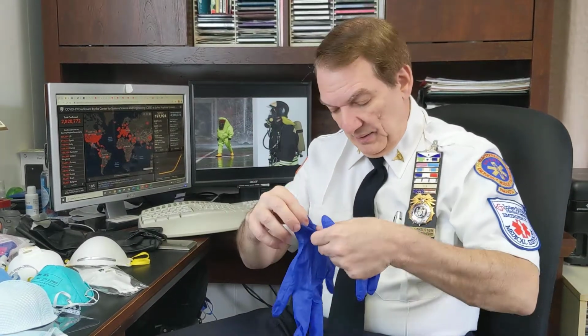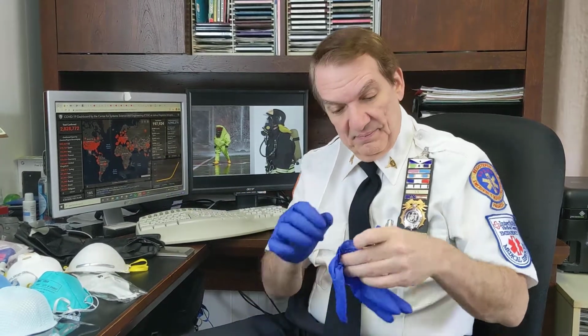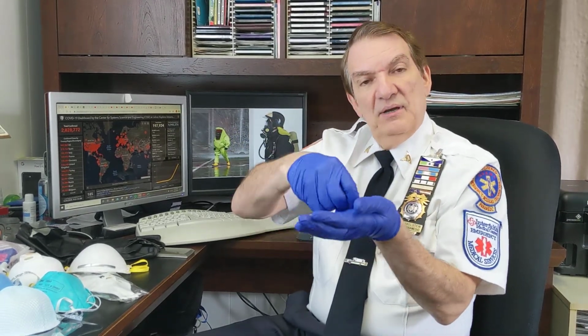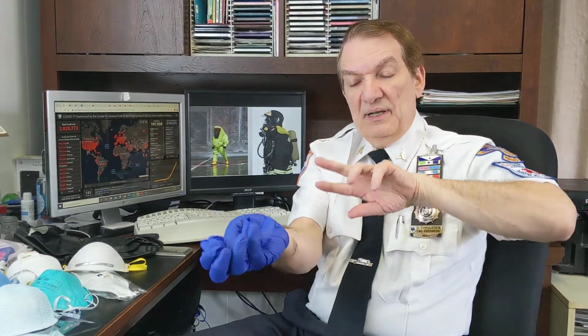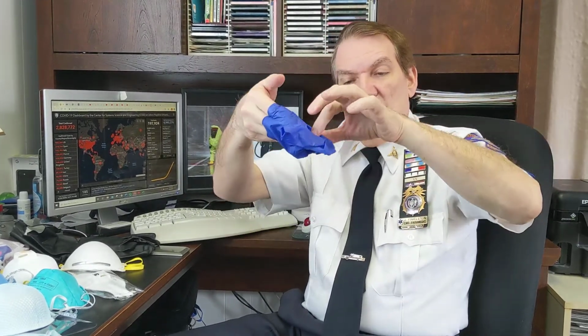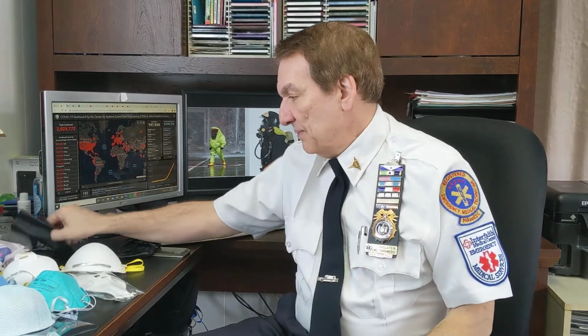So there's a proper way to remove the nitrile gloves, or any gloves actually. I want to be sure that everybody's familiar with this. Once you're finished with using the gloves, you pinch from one side with your dominant hand. You pinch and bring it down, roll it inside, and then with two fingers you go underneath without touching the outside. You bring it all the way around like this, and now it's inside out and it gets discarded as such. Okay, that's the proper way.